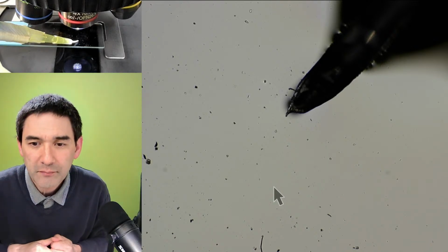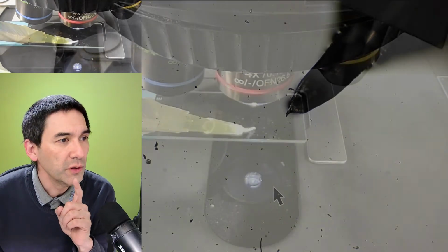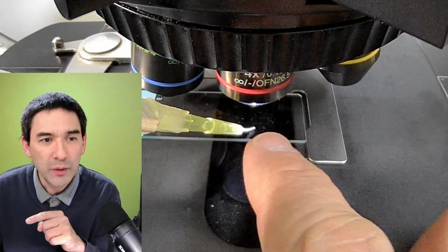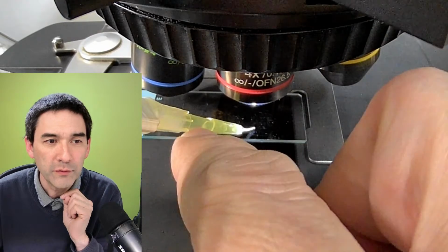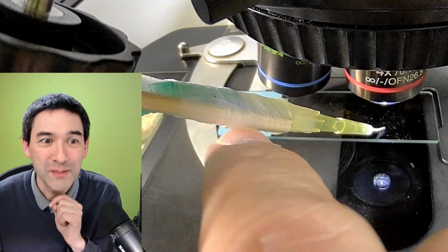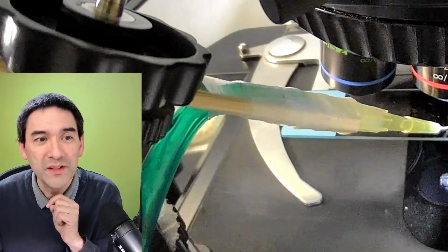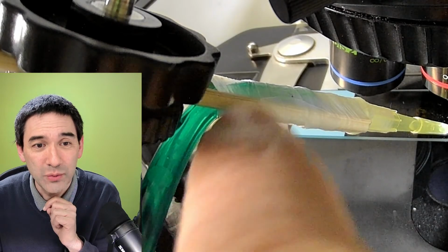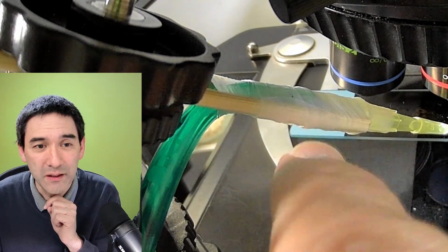Okay, so what is holding the pipette in the air exactly? That's the next question, okay? I would like to show you over here a big view, and I'm going to move over the camera now to show you how I actually connected the pipette. So what I have over here, all the way down here, I'm going to show you how to make it very thin, right? Then I have a part of a more normal pipette, and I'm going to move over the camera. Okay, what do you see over here? Guess what this is? It's parafilm. Right? That's why I showed it to you. I stabilized the whole thing here with some wooden sticks. Okay, here's some wooden sticks. This is the tube, right, that I connected with parafilm to the pipette tip. Some wooden stick for stability, otherwise it's too flexible.